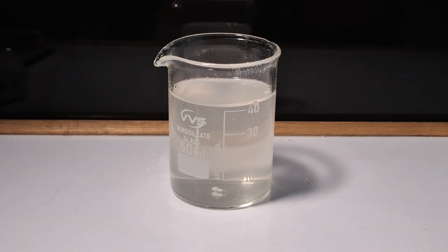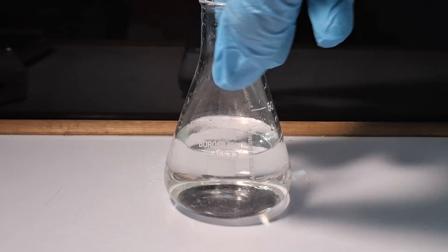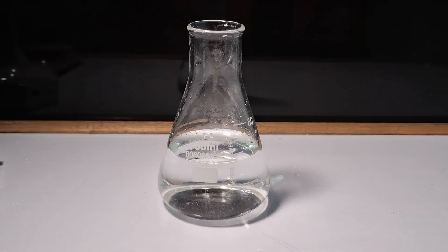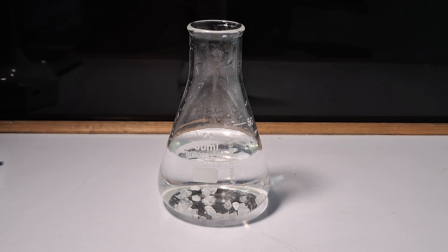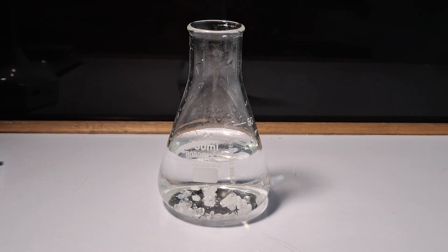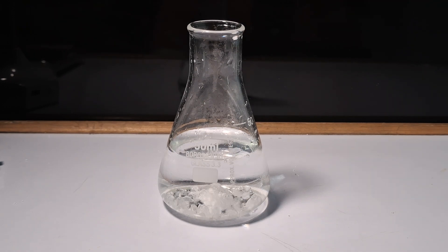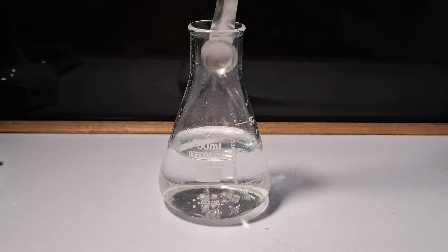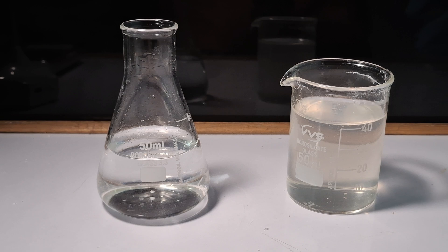After all the sodium benzoate has dissolved, I set the solution aside to start making the citric acid solution. I start by adding the citric acid crystals to the solution in excess. After dissolving all the citric acid, I bring back the sodium benzoate solution to start preparing the benzoic acid.